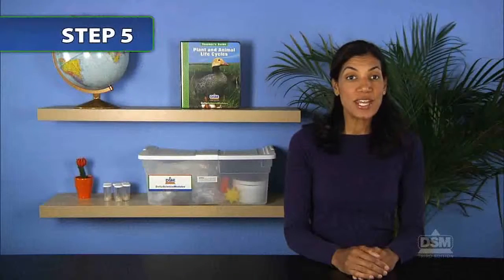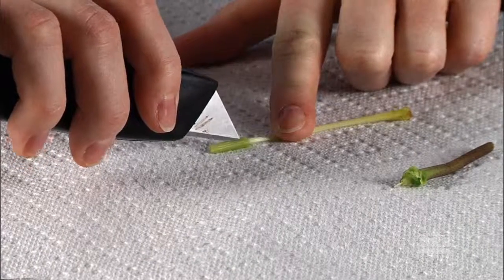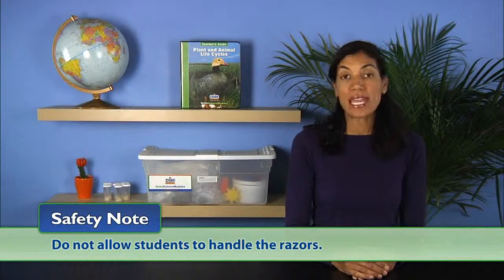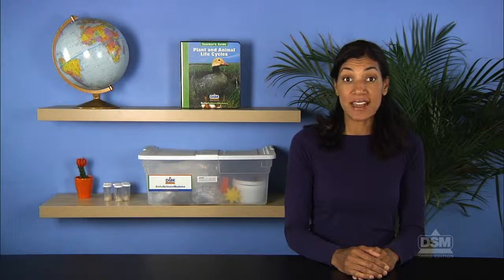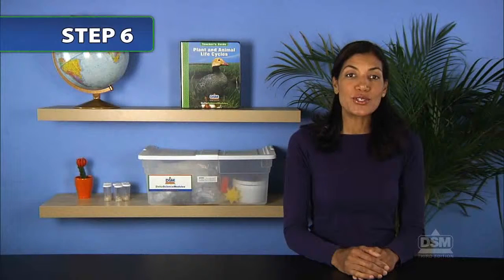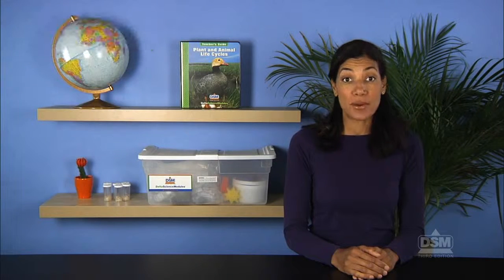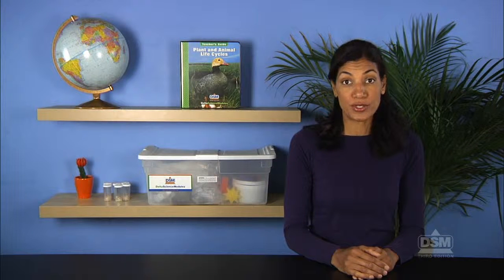Next, using a razor, cut open the ovaries at the base of the pistil from your lily flower. Do not allow students to handle the razors. Invite students to observe the insides, in particular the developing eggs. Encourage students to think about the function of a flower and explain that the stamen produces pollen and the pistil produces eggs. Then inform the class that pollen must join with an egg to reproduce.